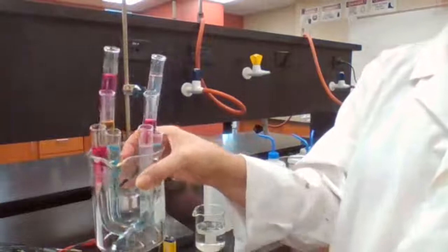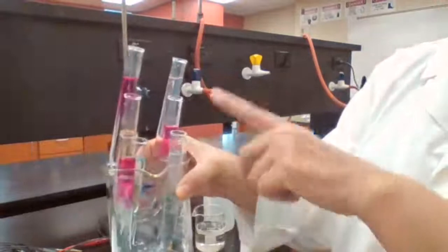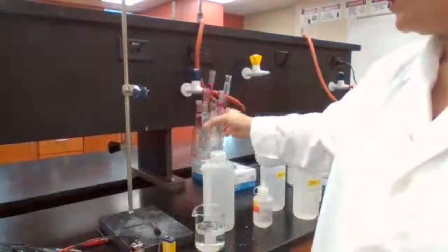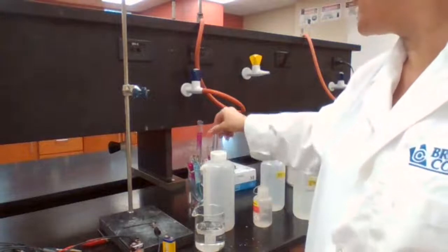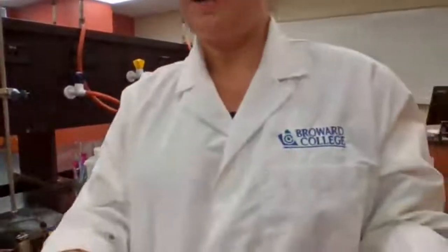For KBr, bromide has been oxidized. So these are the results of the experiment, the evidence for oxidation reduction. Your responsibility is to determine which one has been oxidized, which one has been reduced, and then find out which half reaction goes to the oxidation half and which goes to the reduction half. You do have more than one choice, two choices for oxidation. One of the choices is always water, and based on the evidence of the reaction, you are going to decide which one actually took place.